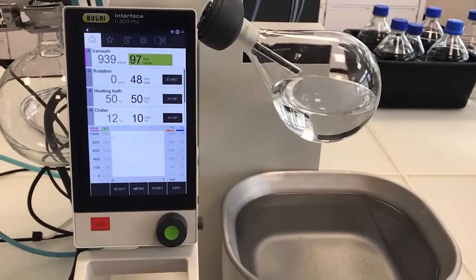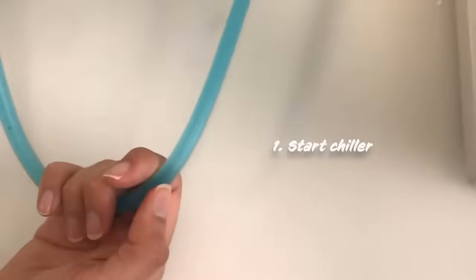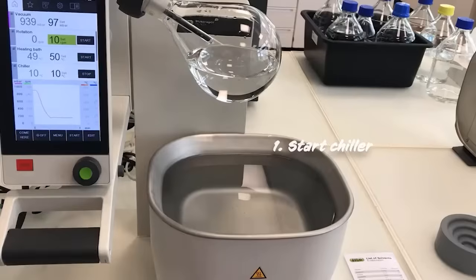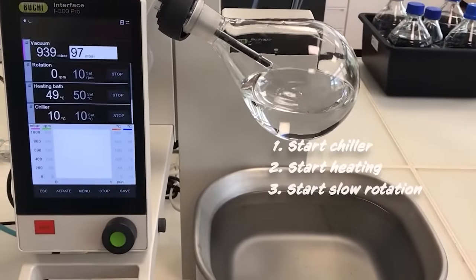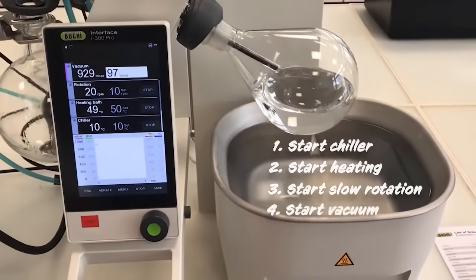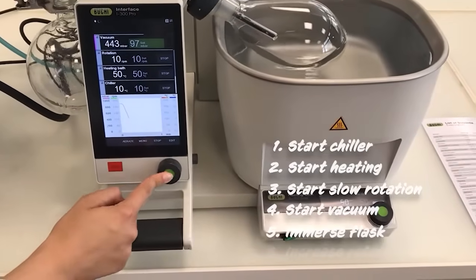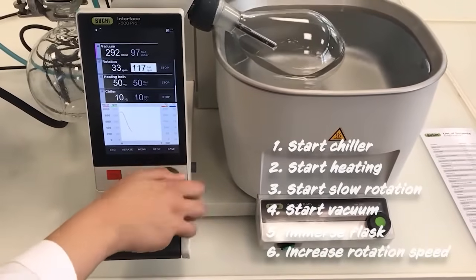Now it's time to start the distillation. Firstly, we start the chiller and check if the coolant is flowing by shortly squeezing the cooling tube — if you can feel a short pulse, it means the coolant is running. Secondly, we start the heating and then start the rotation slowly. Then we press start for the vacuum pump and submerge the flask deeply into the heating medium. Once this is done, we increase the rotation speed to 280 RPM, which is the optimal rotation speed.